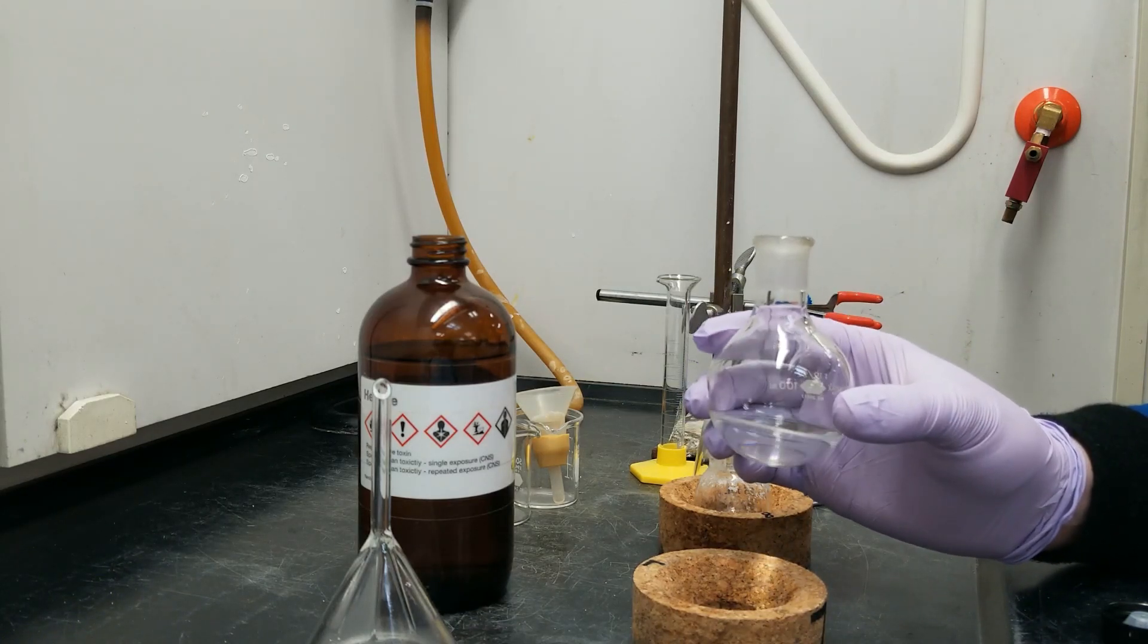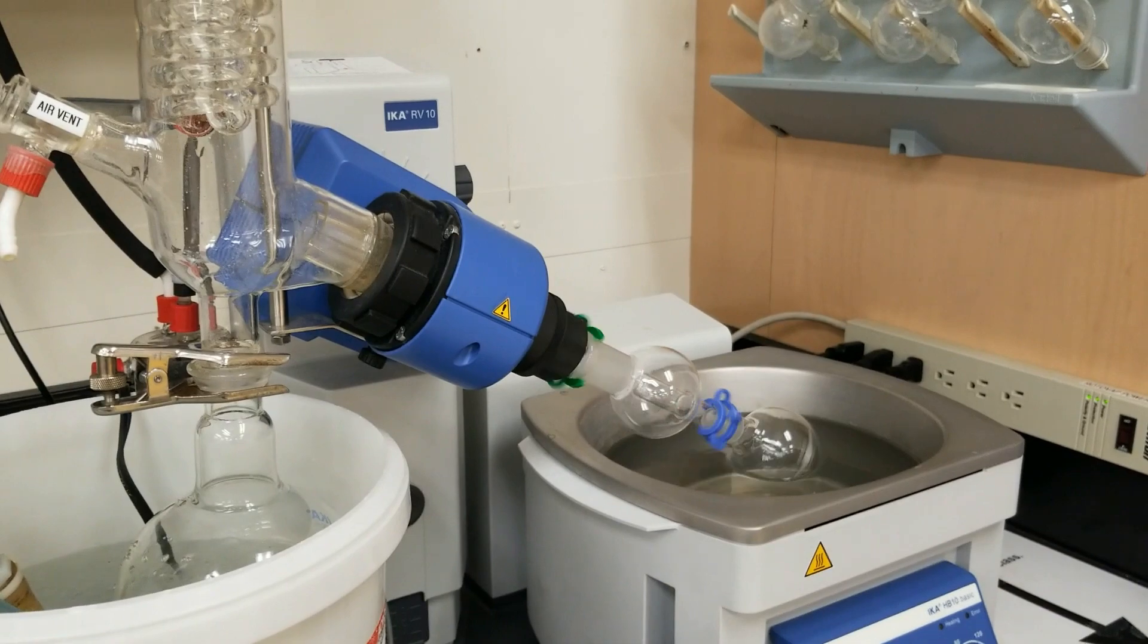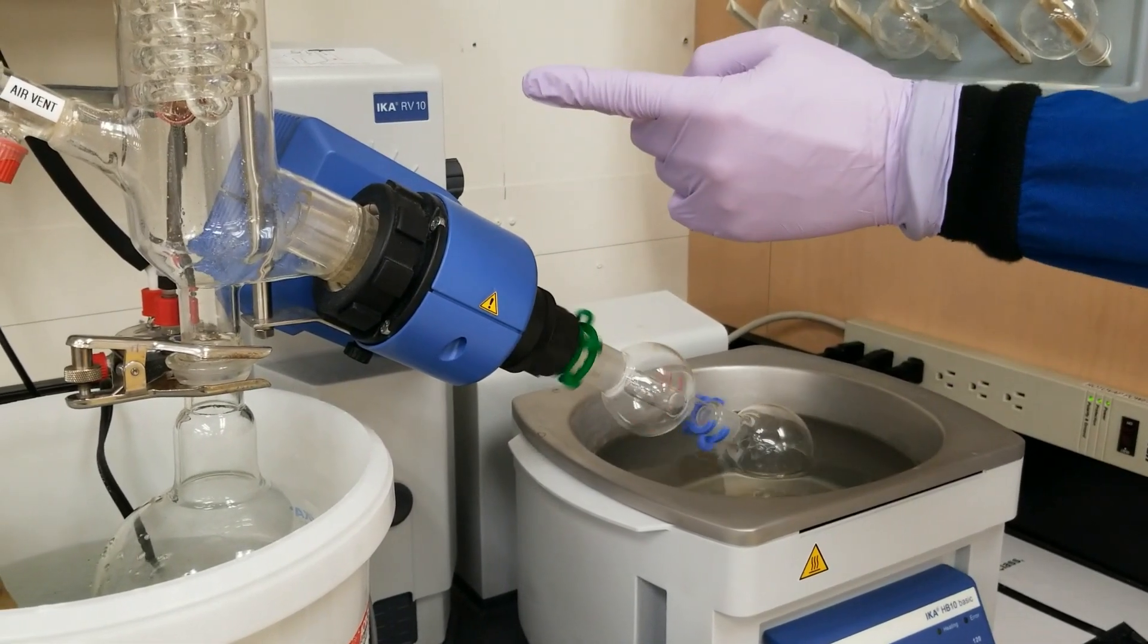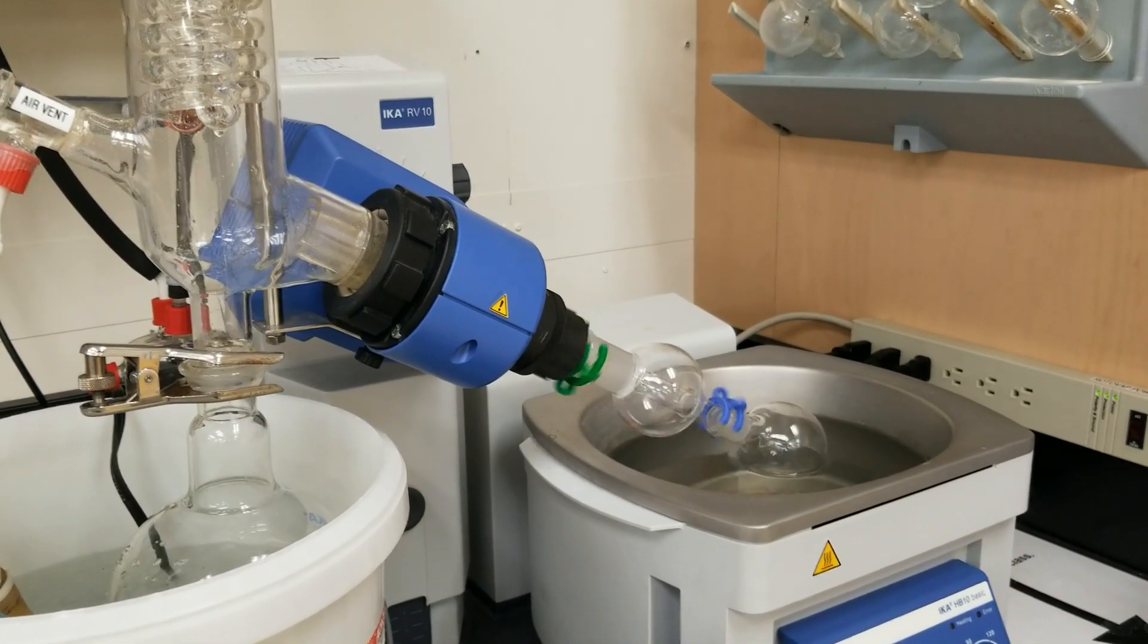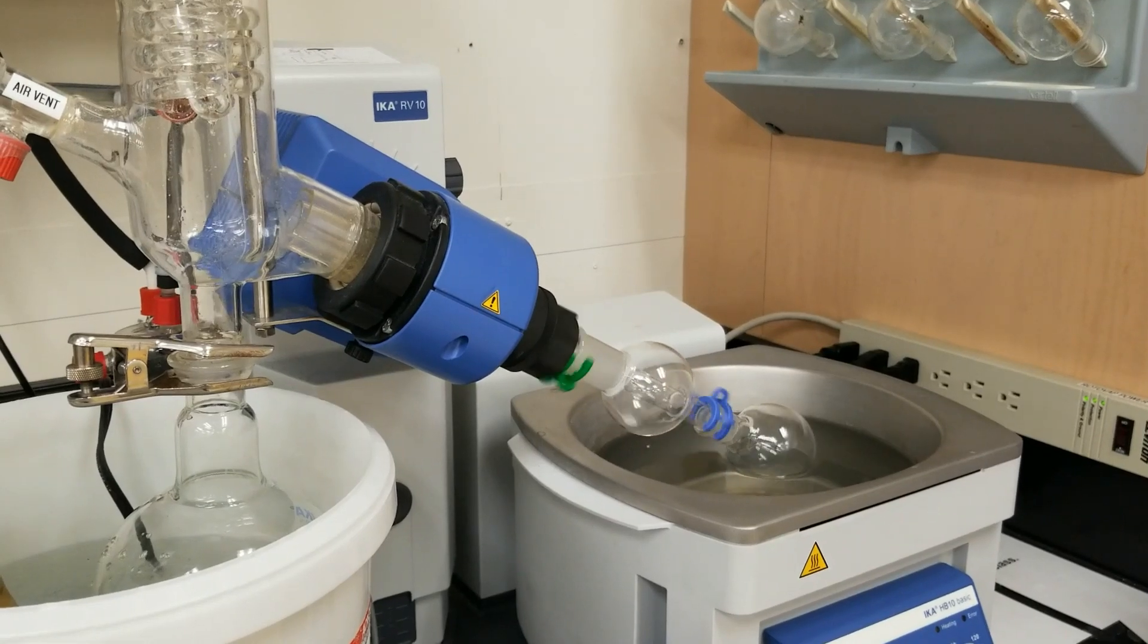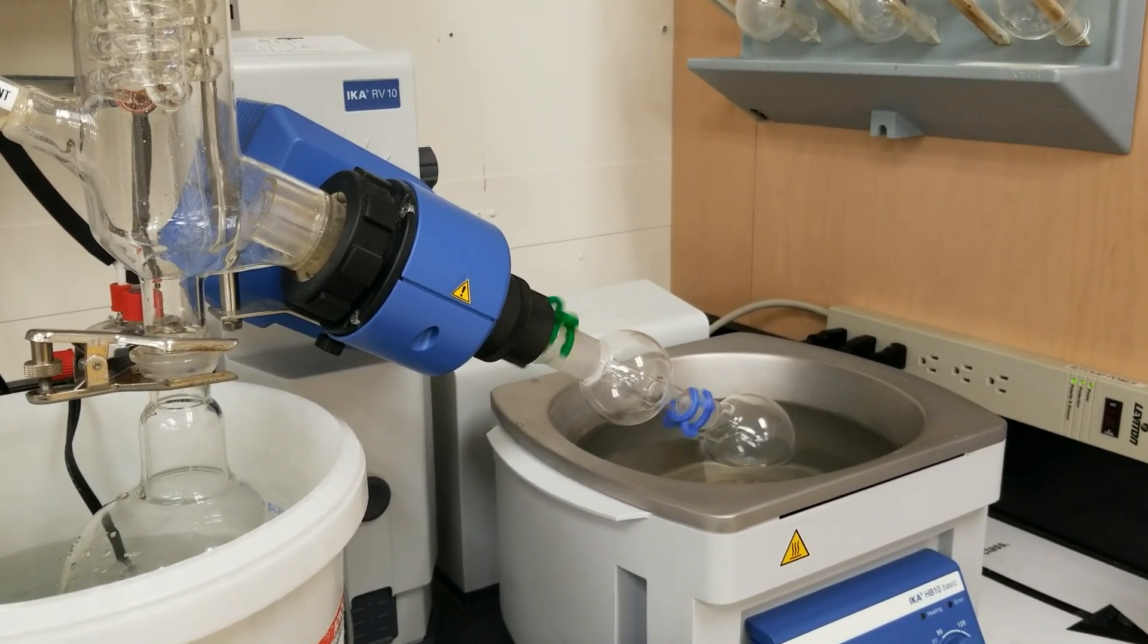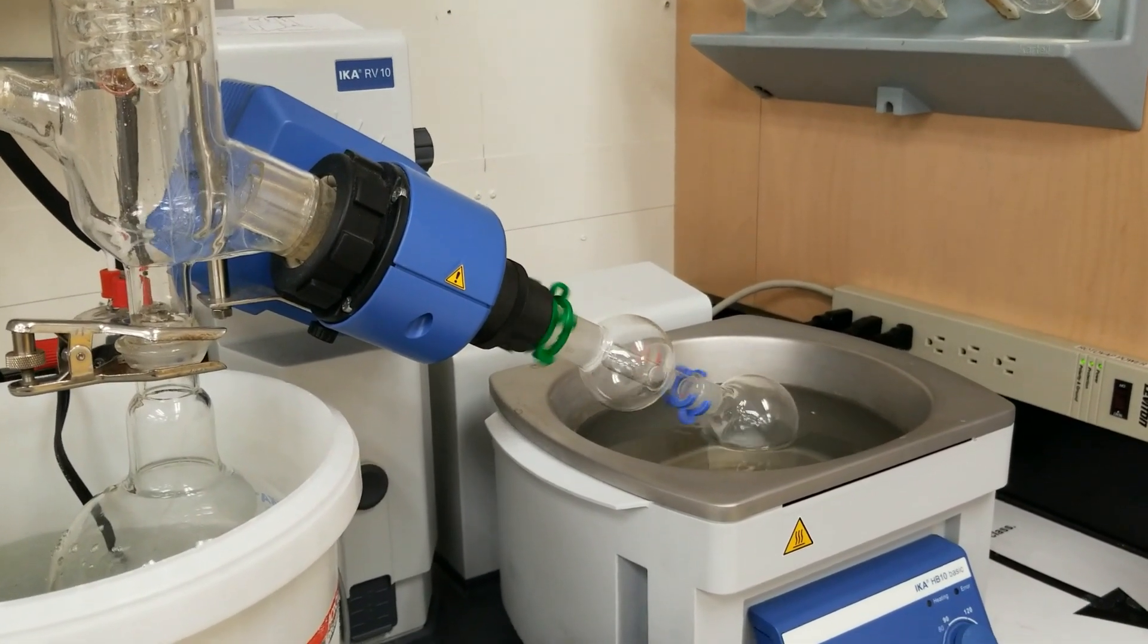So there's no need to incorporate a drying agent. But I'm going to go rotovap this and come back. Okay, and so we're on the rotovap now, and hexane being super volatile is not going to take super long. So you can see that it's condensing up here on our cold finger. It's already starting to cloud up as the solvent is removed. And eventually, I'm going to assume it's going to get kind of a snowball appearance here.